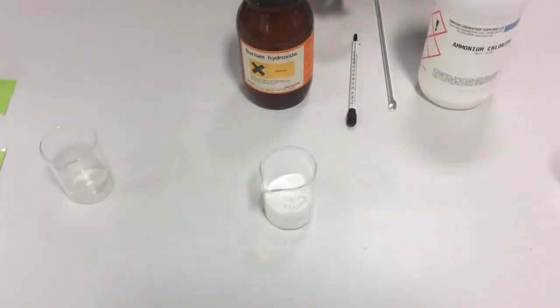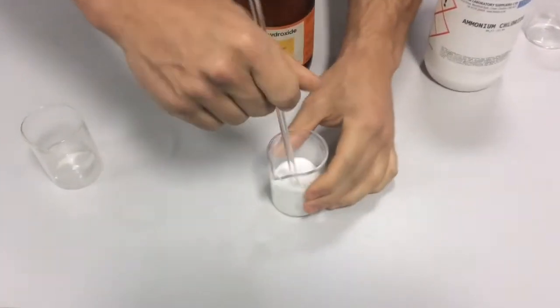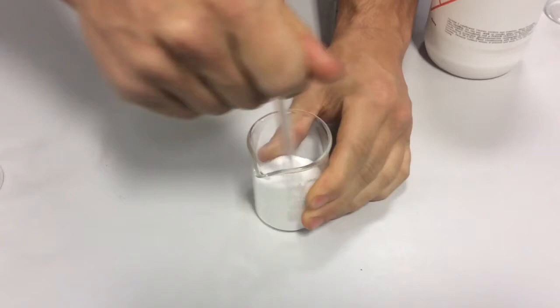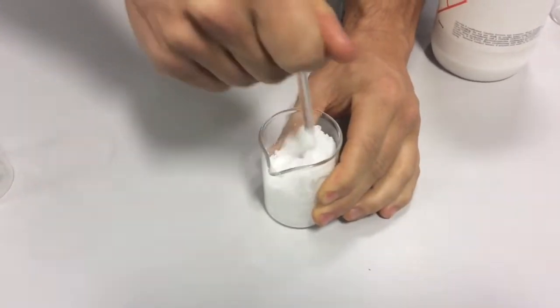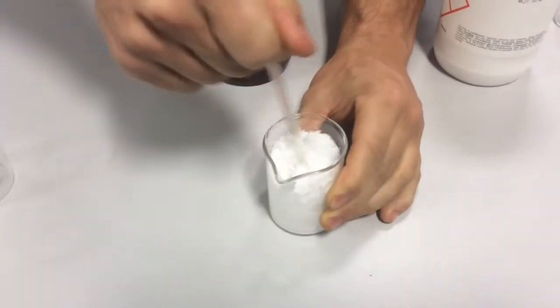I've got a glass stirring rod, and what I'm going to do is start stirring these chemicals together. Now as I start stirring, it allows this chemical reaction. Can you see this is starting to change?